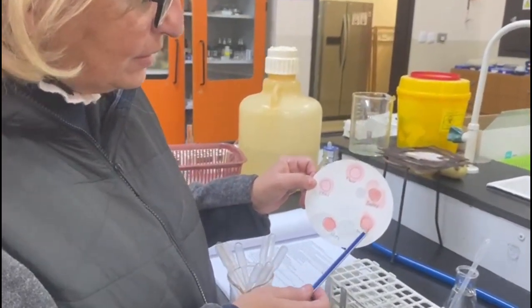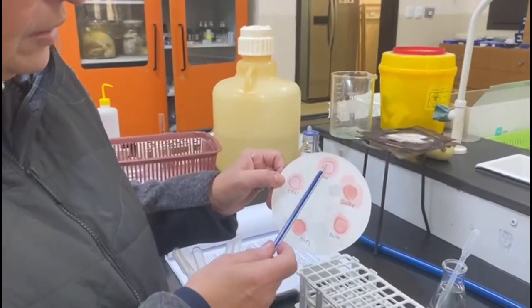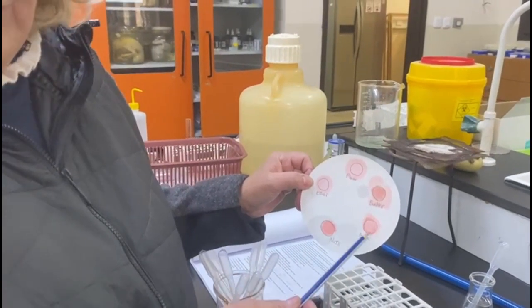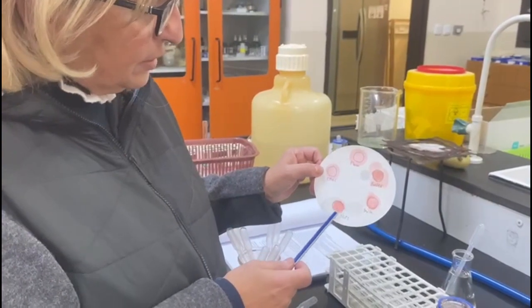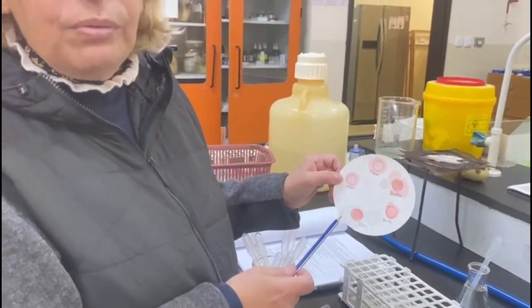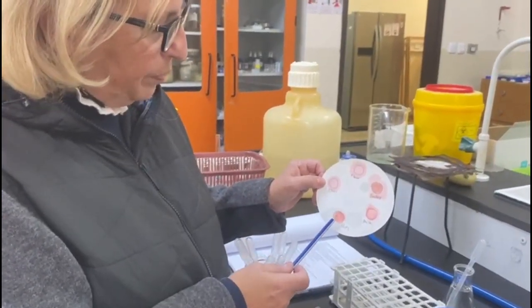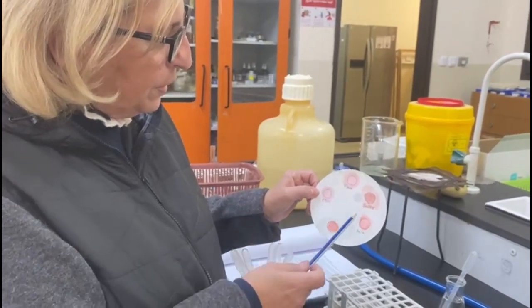Milk has a little bit more than ether, between ether and butter, so there is some fat in milk. And nuts also have a relatively large amount of fat, almost comparable to the one of butter. Compared to the negative control, there is much more fat in nuts and butter compared to flour and milk.